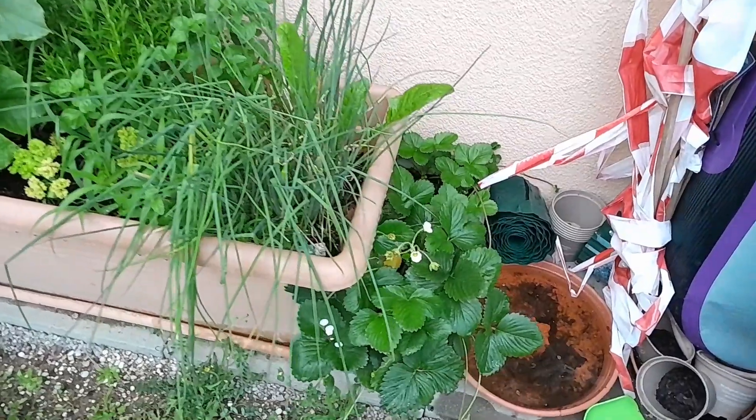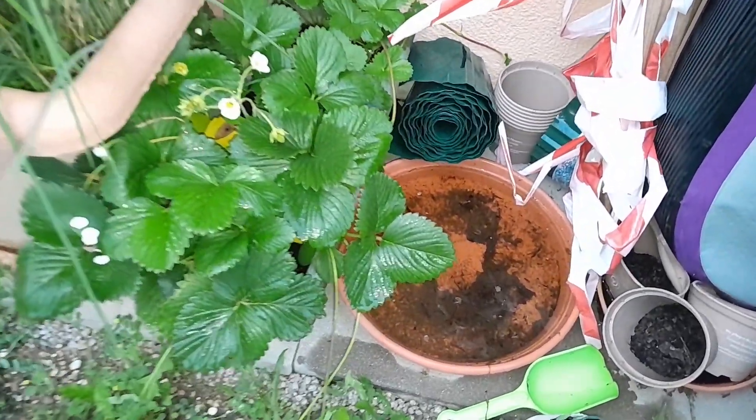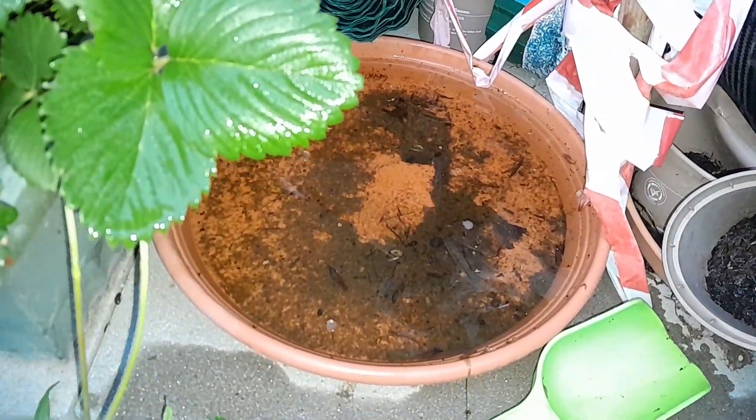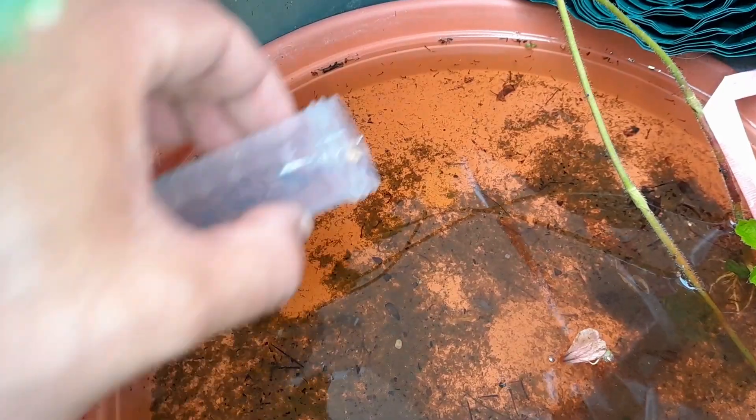And in this case, also mosquito larvae. Especially in tropical regions, standing water is not a good thing because those mosquitoes that develop there can also transmit malaria. So I'm going to now collect a water sample and then let's have a closer look at it under the microscope.